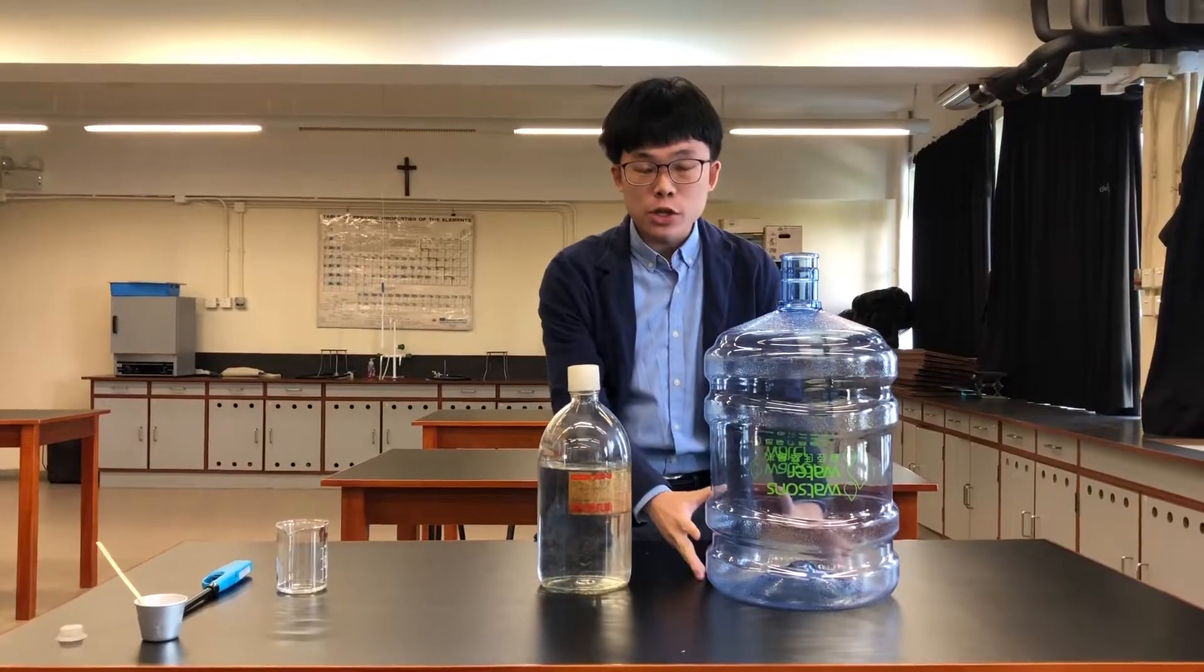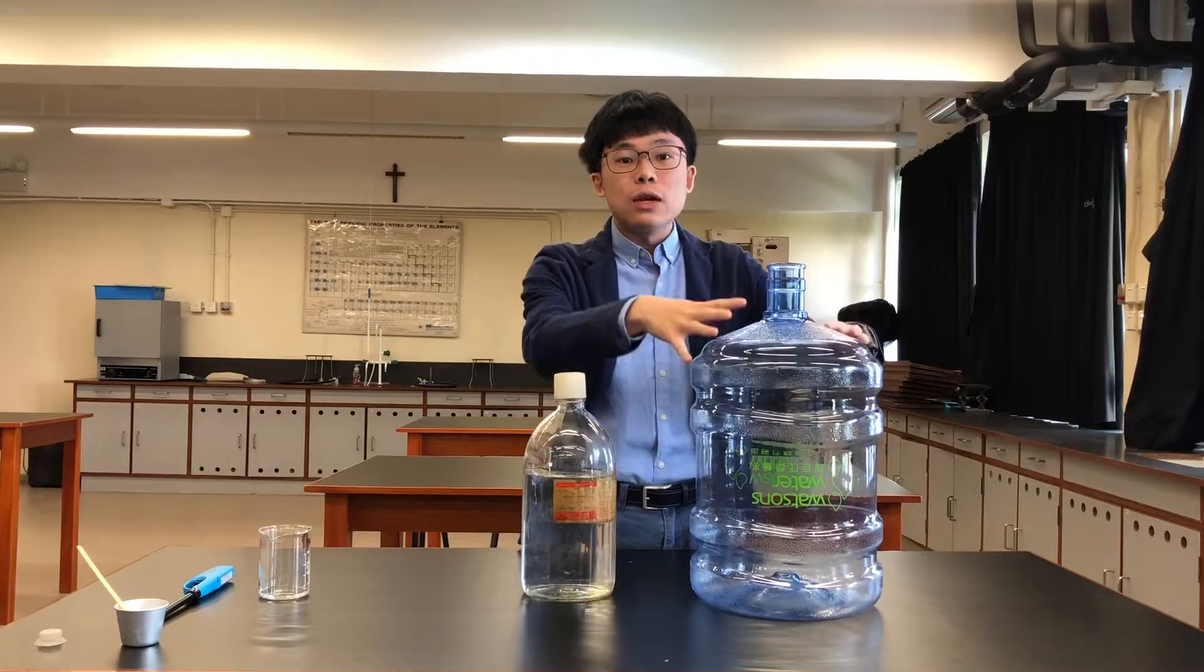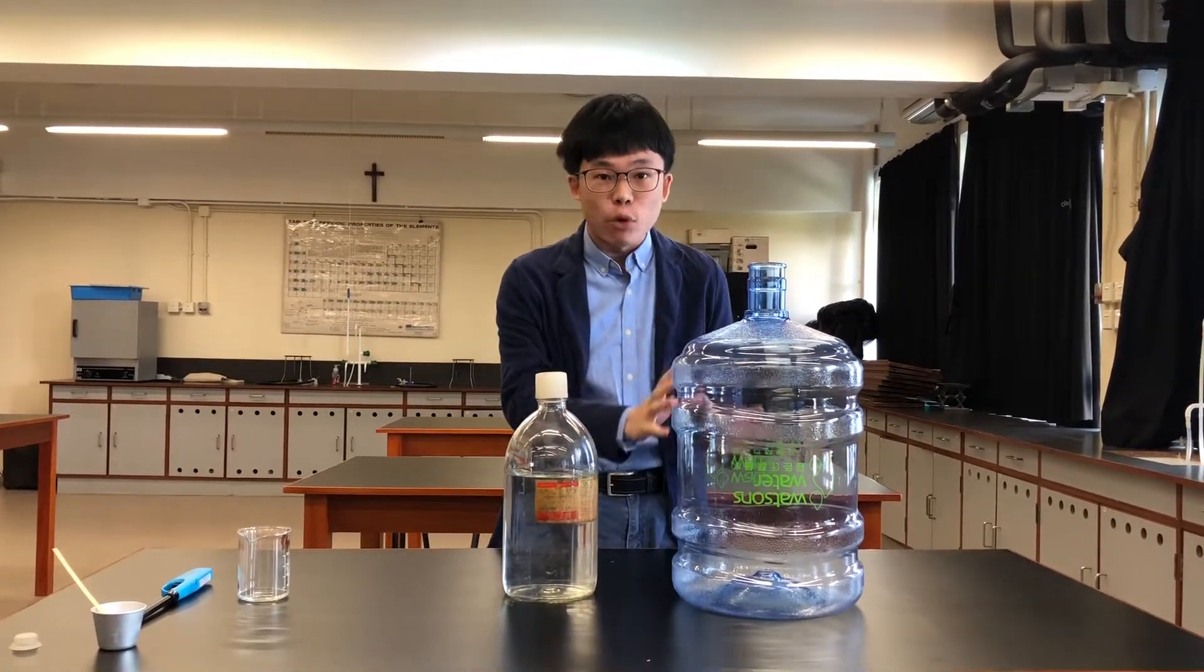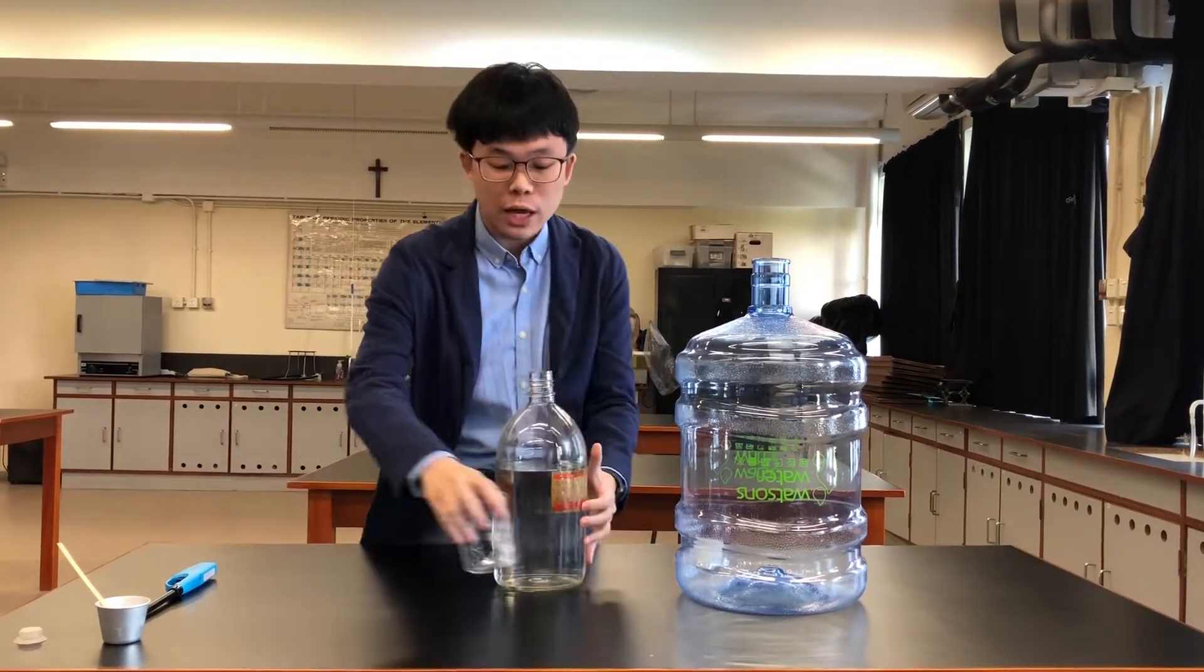Make sure you notice the whole process when I ignite it - what's inside the water bottle and what is being formed inside. Now we're going to pour the alcohol into the big cup first.